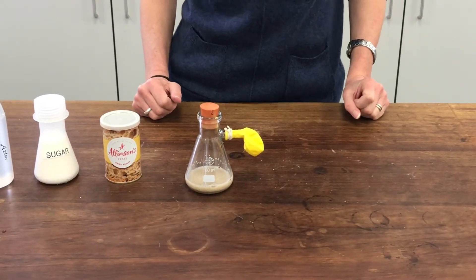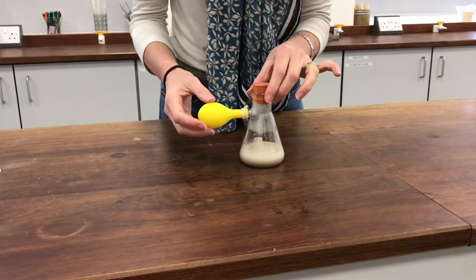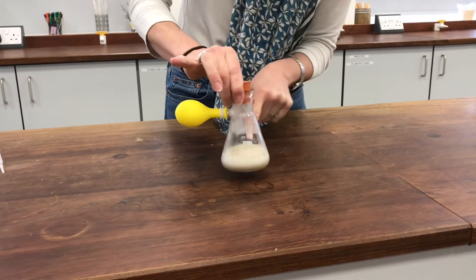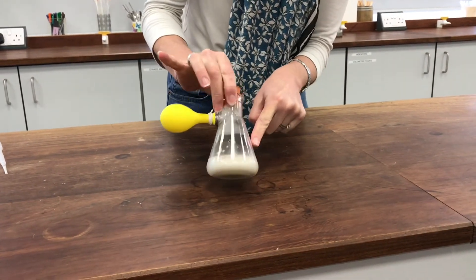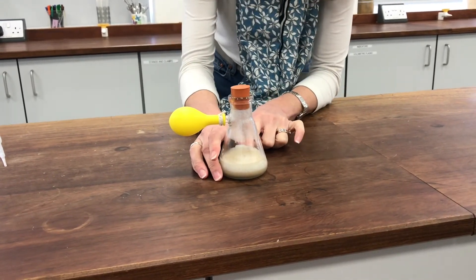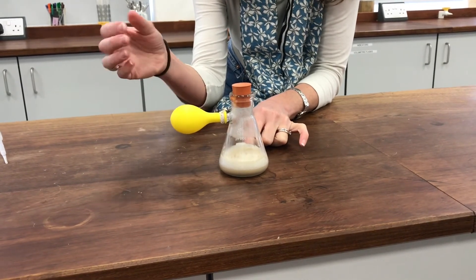I'll join you again next week — this is my mixture a week later. You can see that the balloon has really puffed up and it feels quite firm as well, and you can even see that there's quite a lot of froth on the top of the yeast mixture in here. So I'm assuming that the yeast really has fermented my sugar solution and made a lot of CO2 as a by-product, and that's what's inflated the balloon.